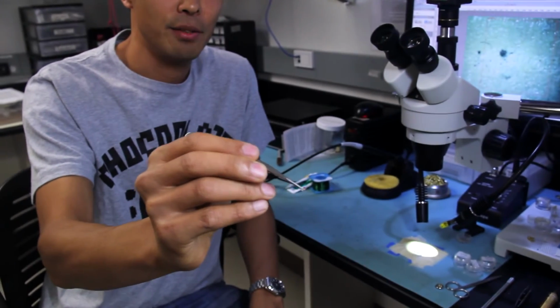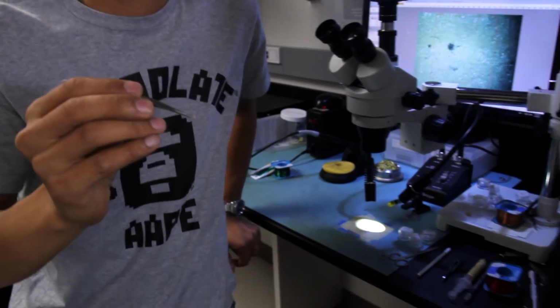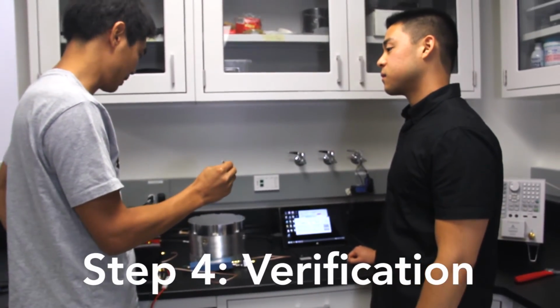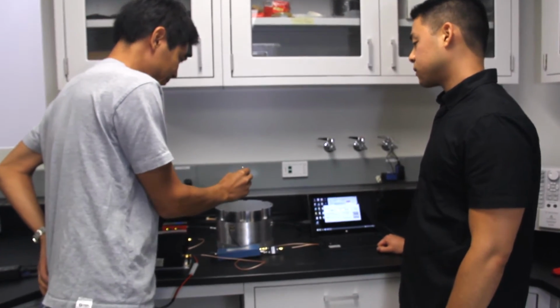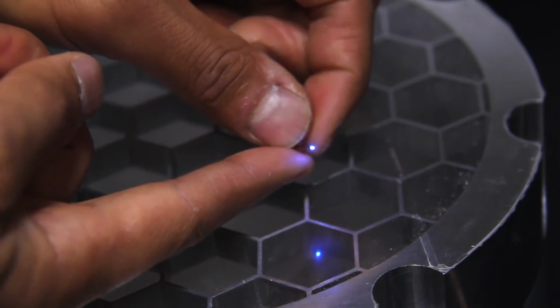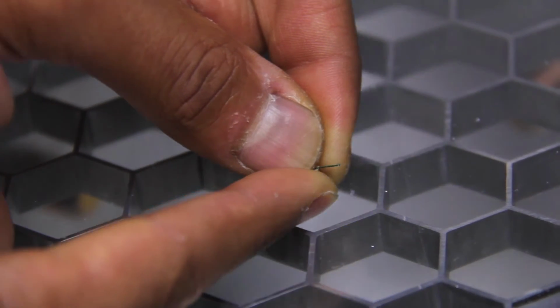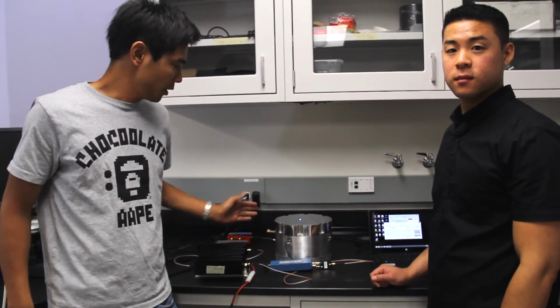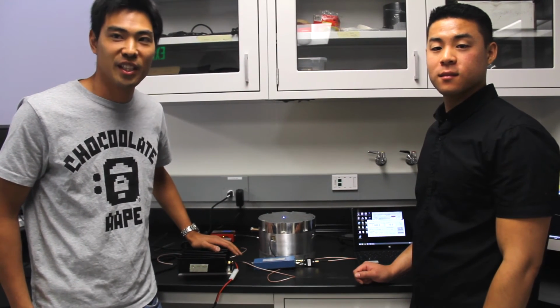Okay, let's test how it works. The final product, let's try how it works. Let's do it. On. In the air, it doesn't work well, but holding it by hand, imitating a mouse, it works well. The pulsing will be controlled by the signal generator, and it still moves but still turns on. Okay, so this is what we built, a wireless optogenetics setup. So please enjoy making it yourself.